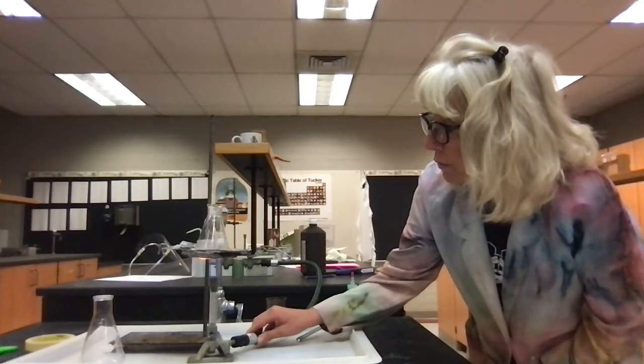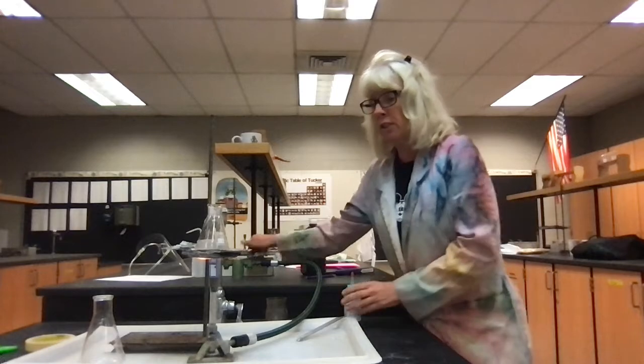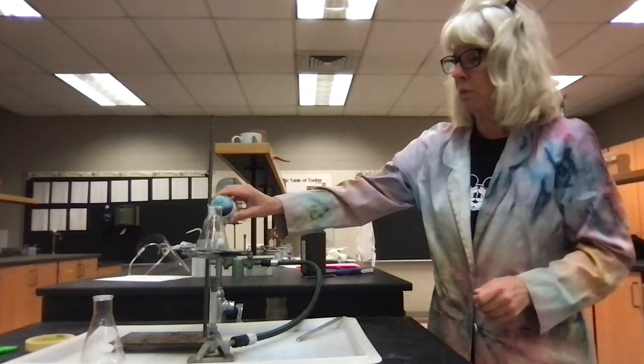But what I'm going to do is, this is going to take probably an hour for the reaction to go to completion. So instead, I'm going to turn this off, and I'm going to show you what happens if I add a catalyst. Okay, so let's see. Watch what happens.